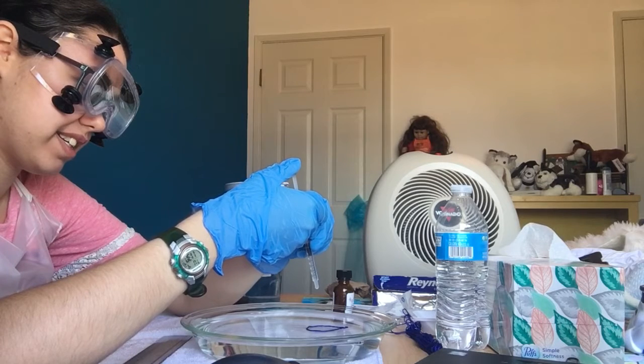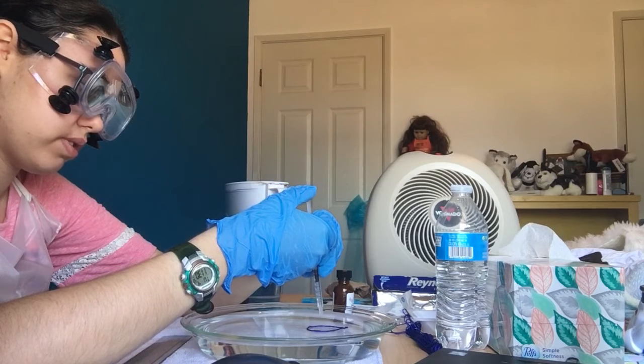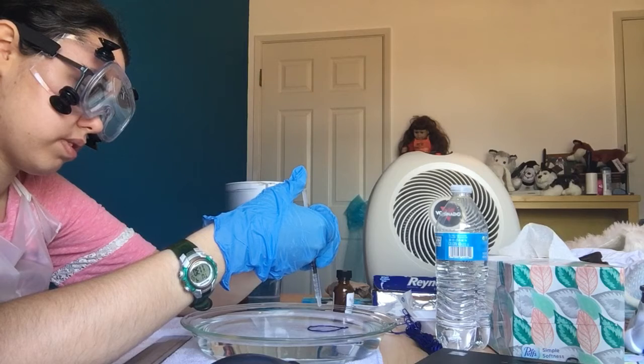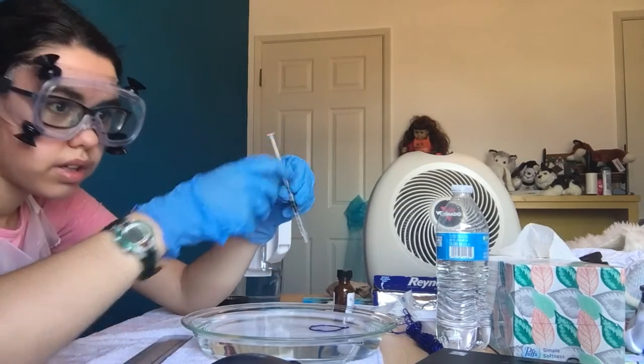Yeah. Enter. Oh, it's getting wider. Interesting. Oh.